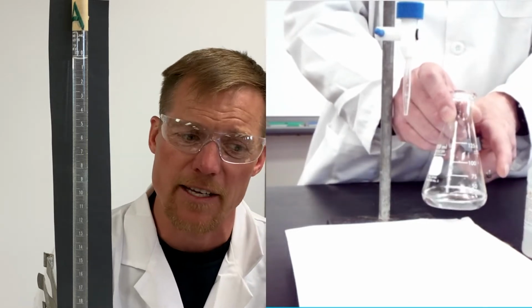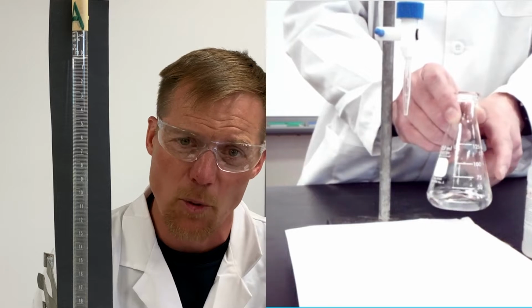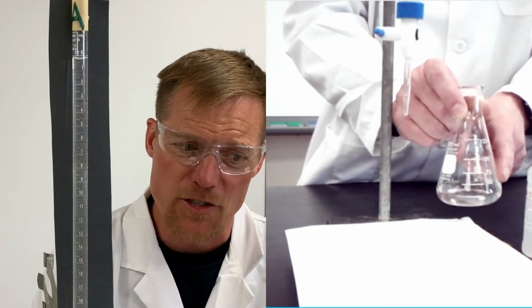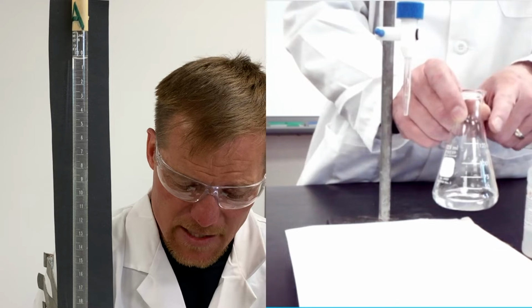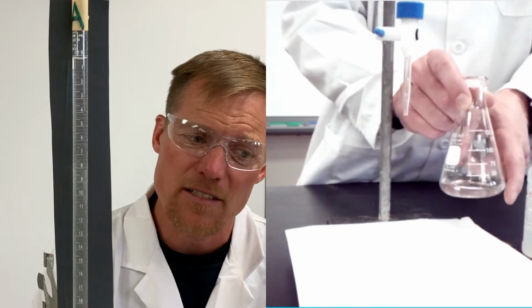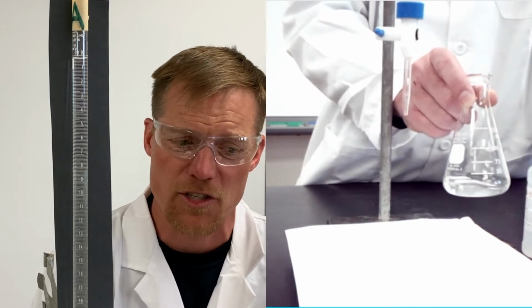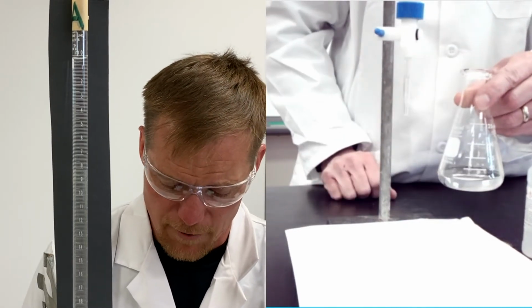Basically, we're taking all our kids, all our H pluses and our OH minuses, and we're throwing them into a pool, right? And it could be 20 milliliters, it could be 30 milliliters of water. It doesn't matter. The color change is gonna tell me when we've reached our endpoint. So as they go into our Erlenmeyer flask, it doesn't matter that they're interacting in a pool, basically. They're kind of all playing in the pool and eventually they're gonna cancel each other out. So it's okay that we've got water in this Erlenmeyer flask.